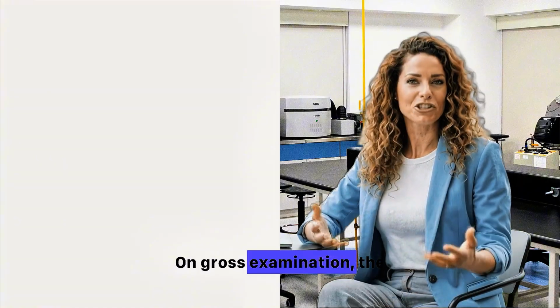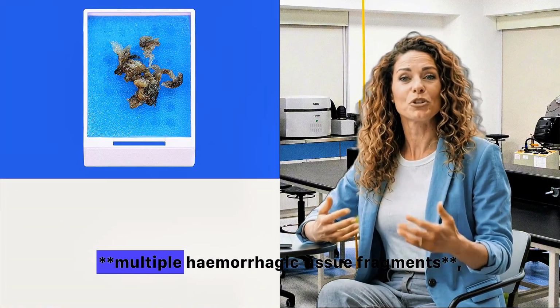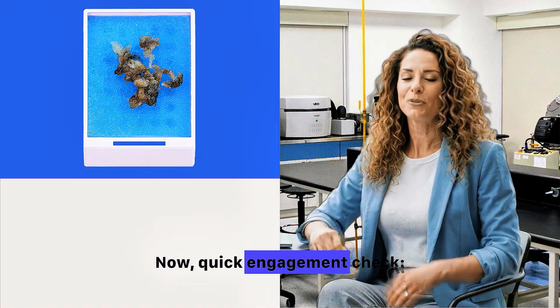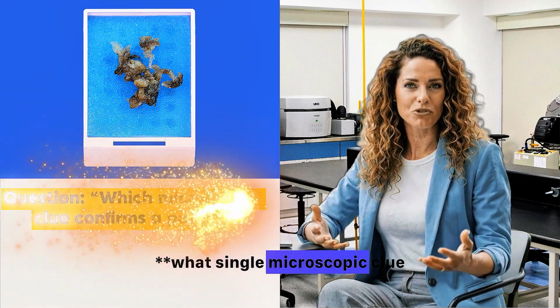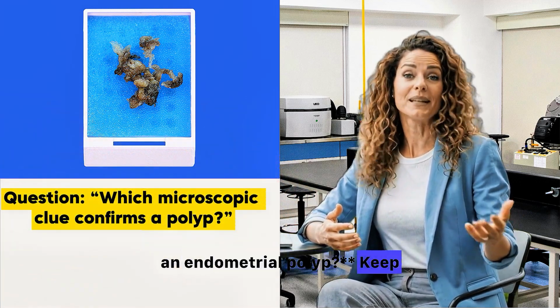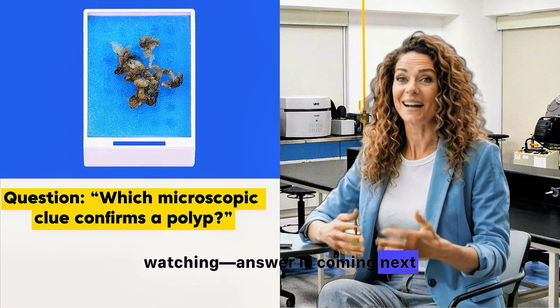On gross examination, the specimen is described as multiple hemorrhagic tissue fragments, which is very typical for curettage specimens. Now, quick engagement check. What single microscopic clue would most strongly support an endometrial polyp? Keep watching. Answer is coming next.